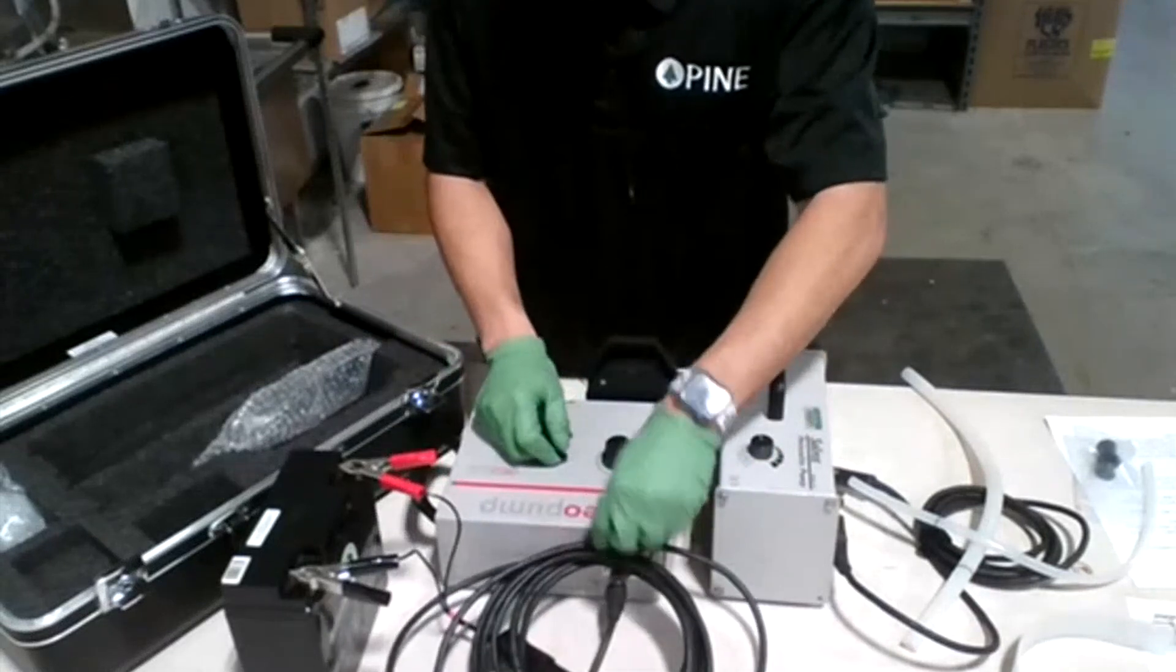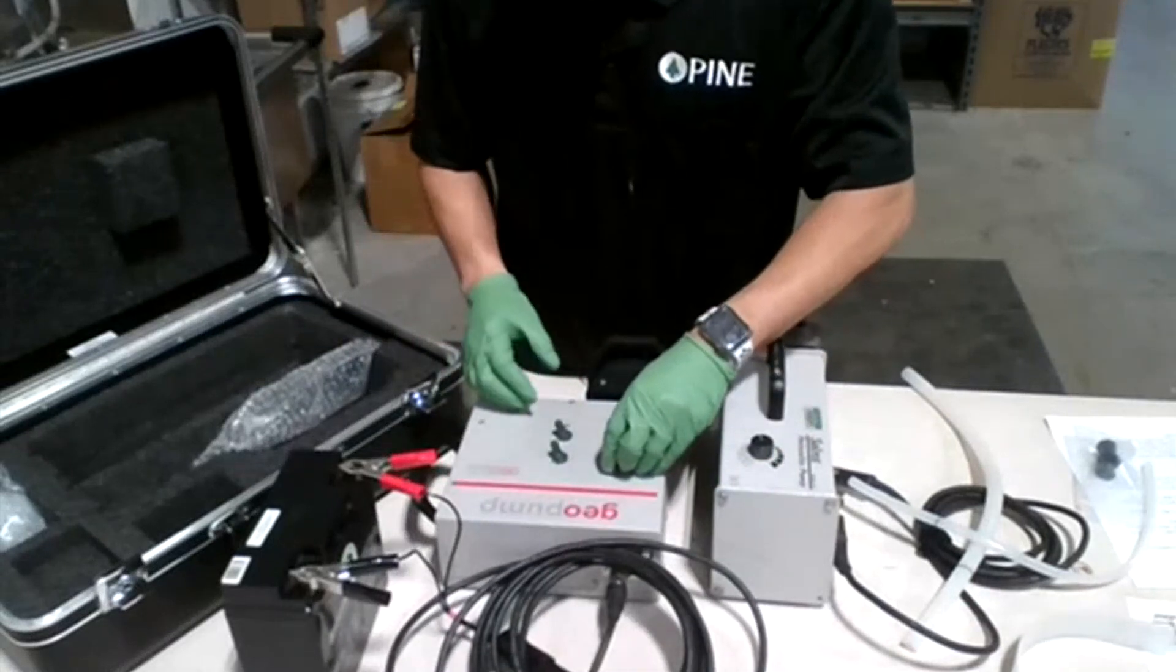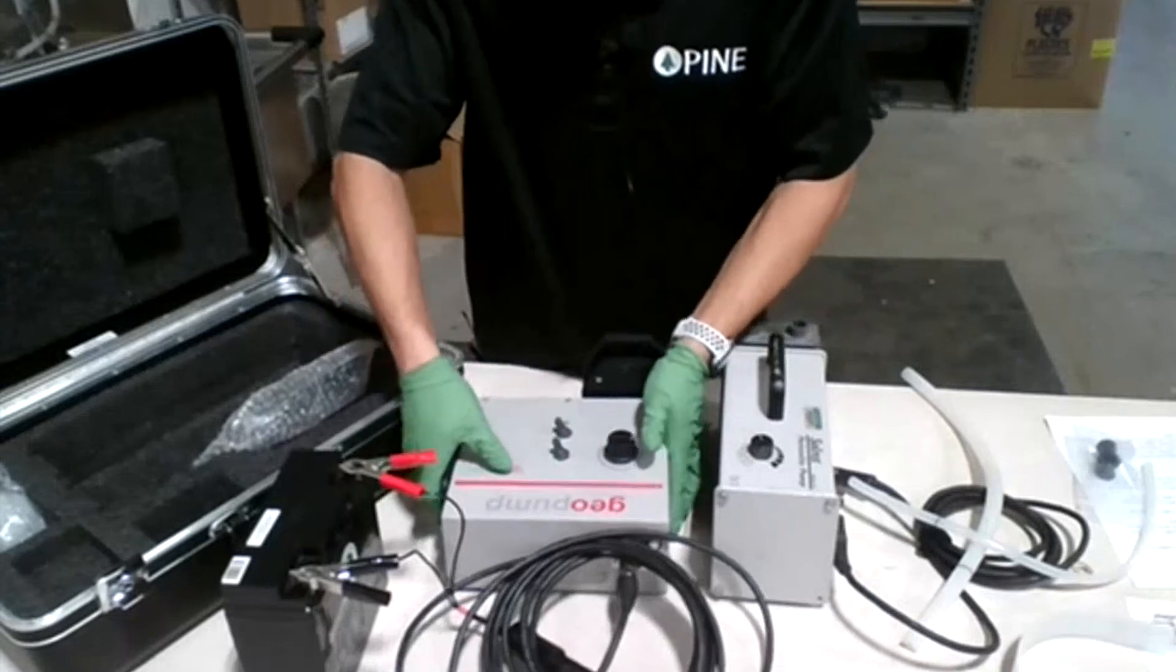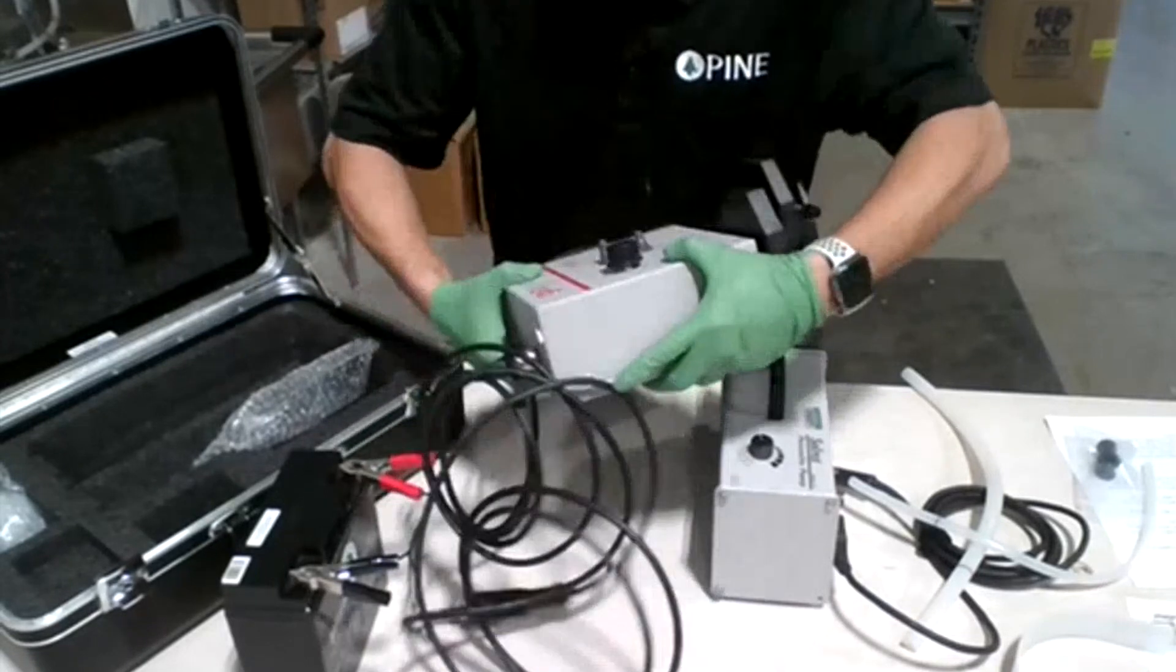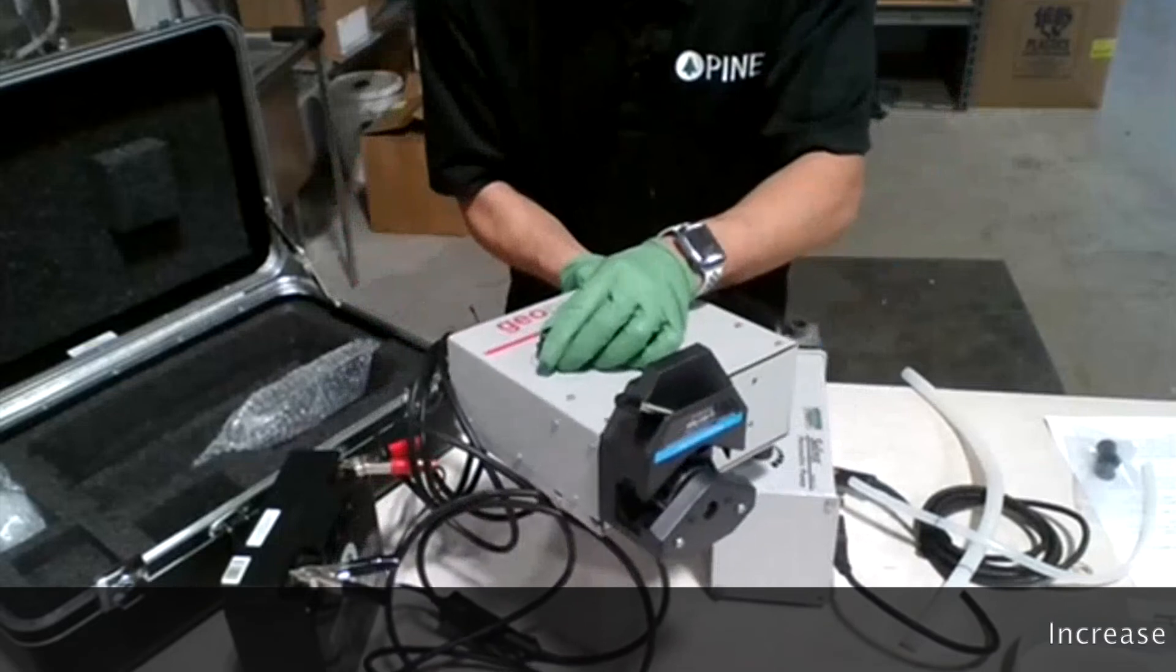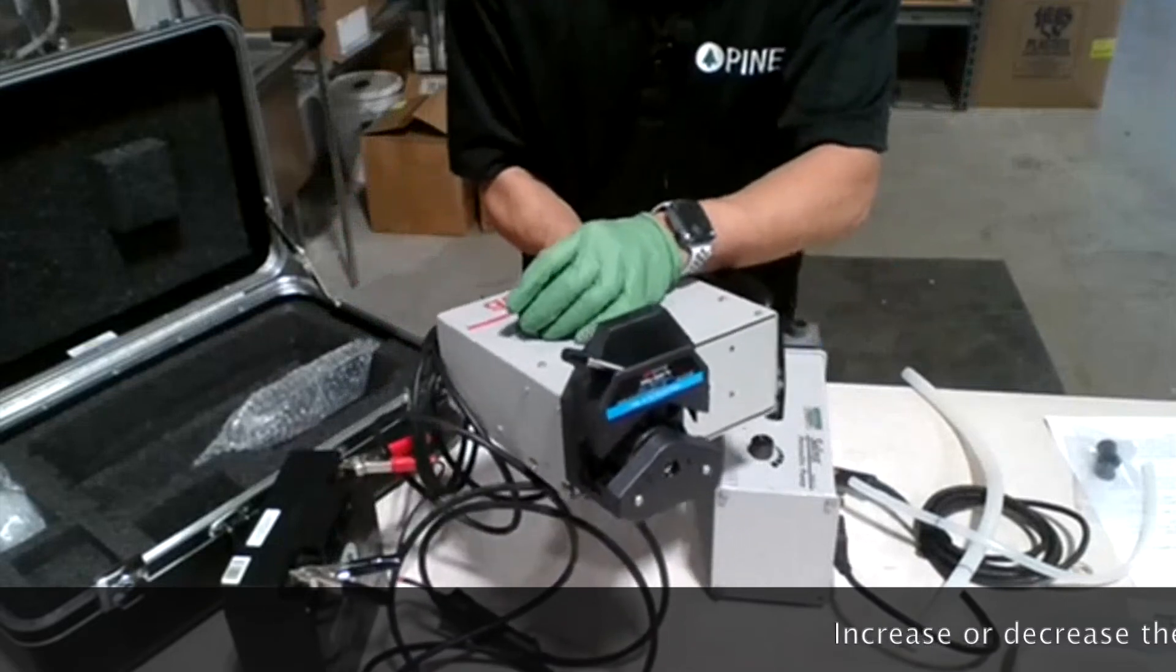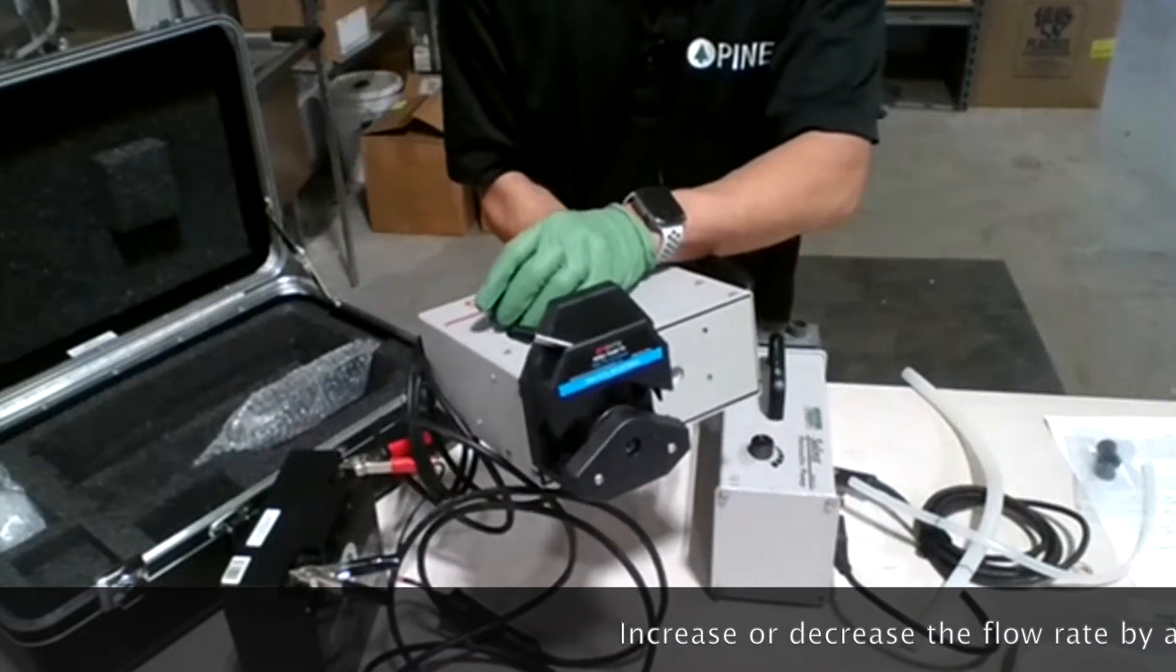Simply just turn it on and you can increase or decrease the speed as you wish.